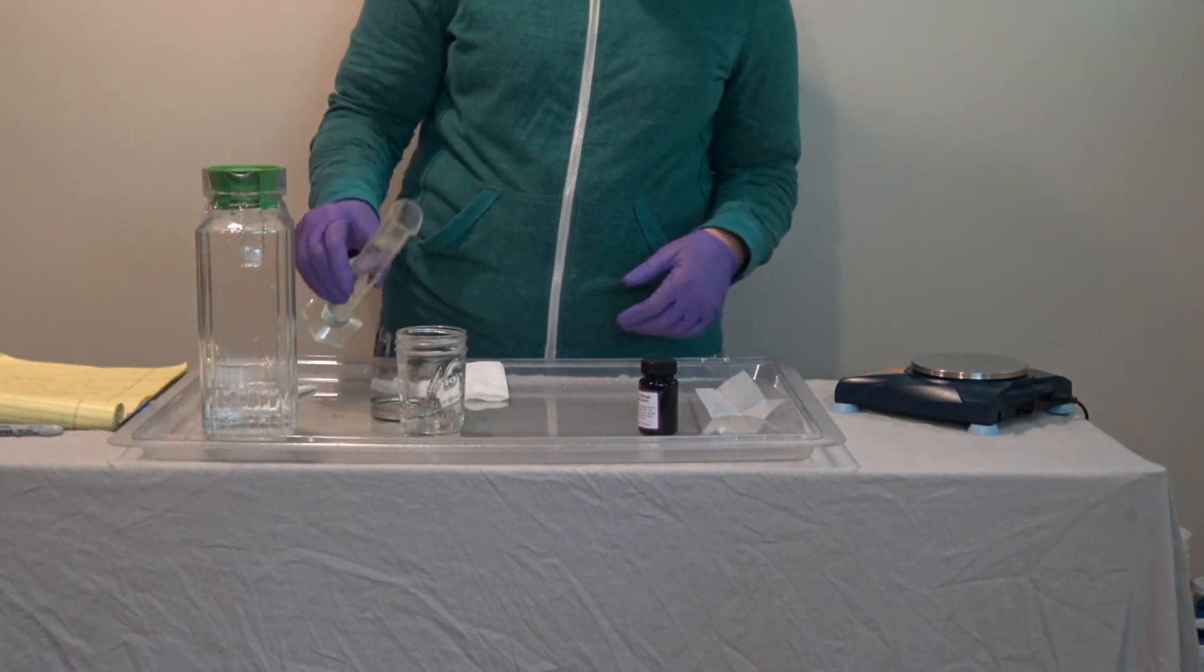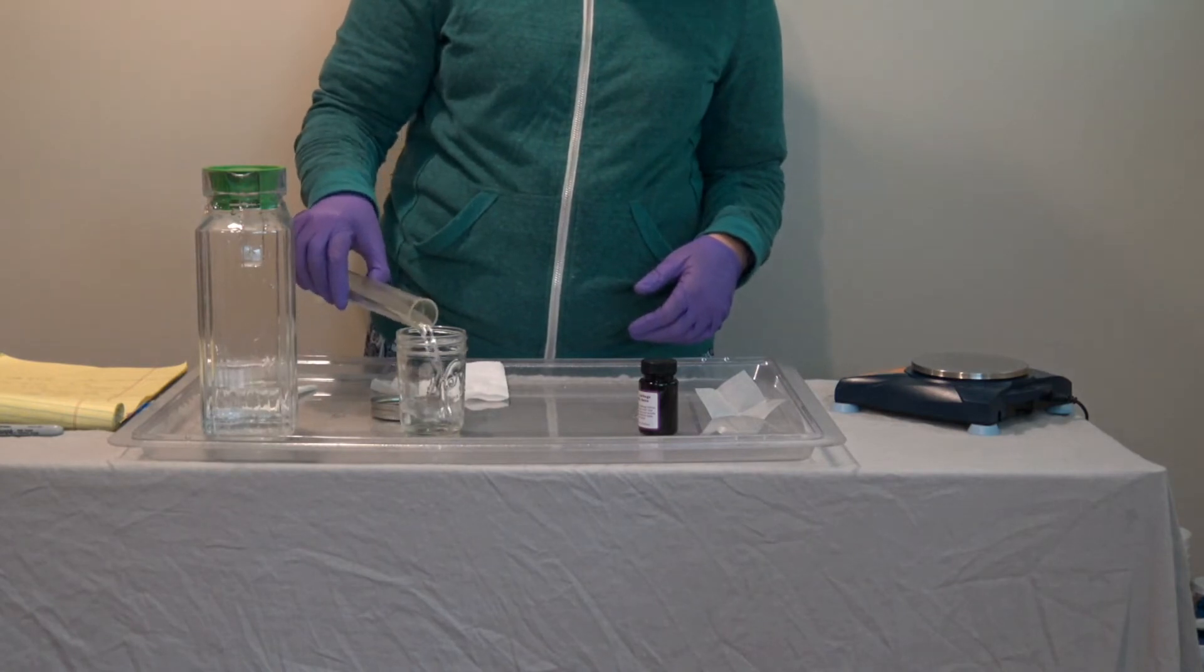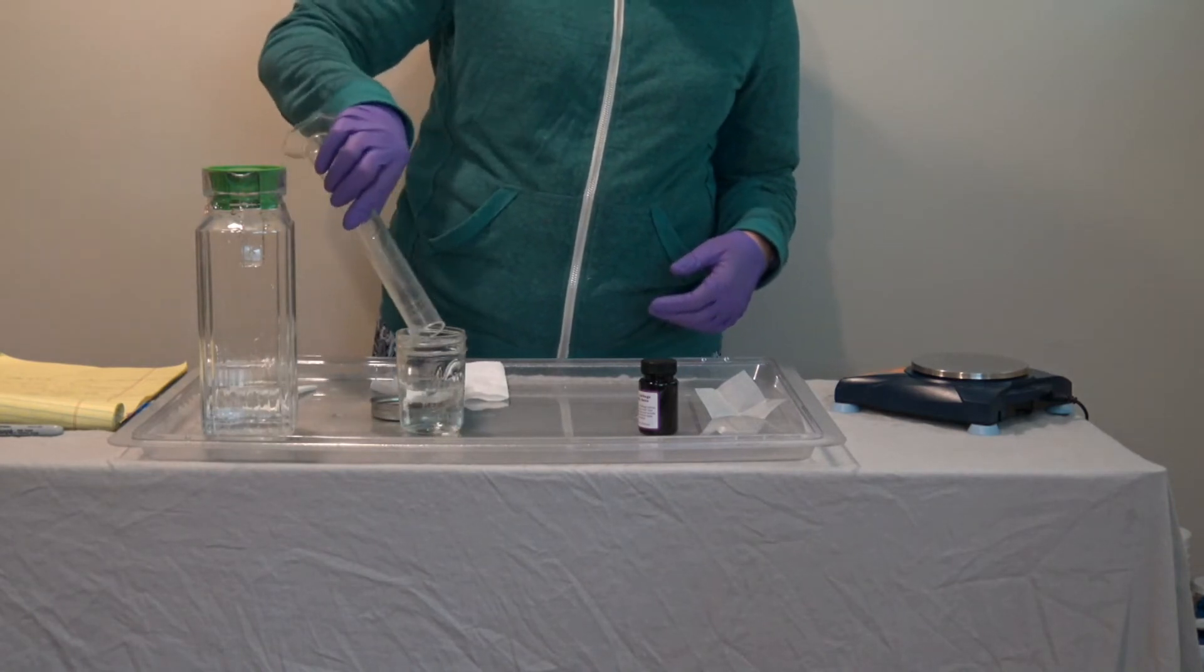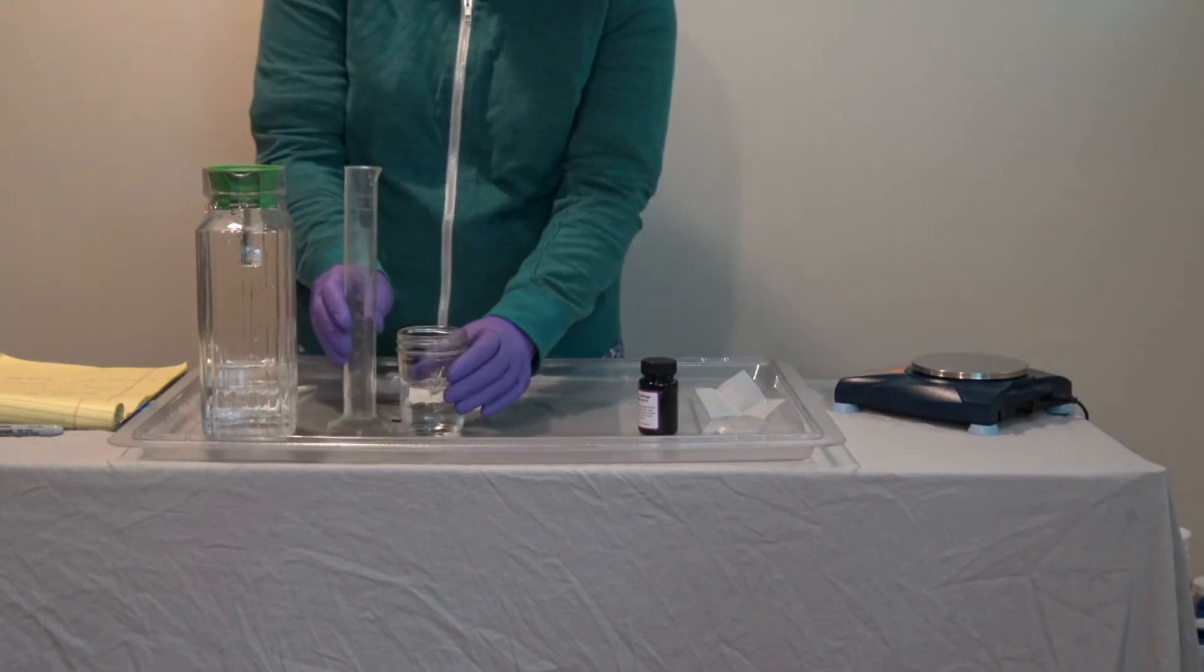So here's my 100 milliliters water. I'm going to place it into a container for mixing the cabbage juice.